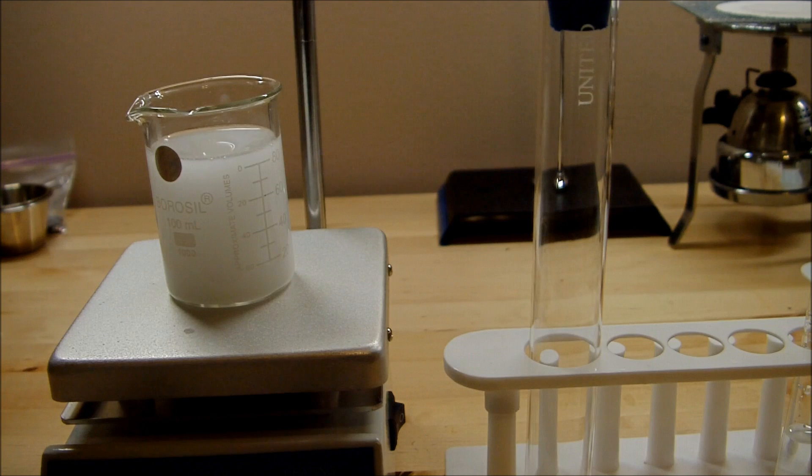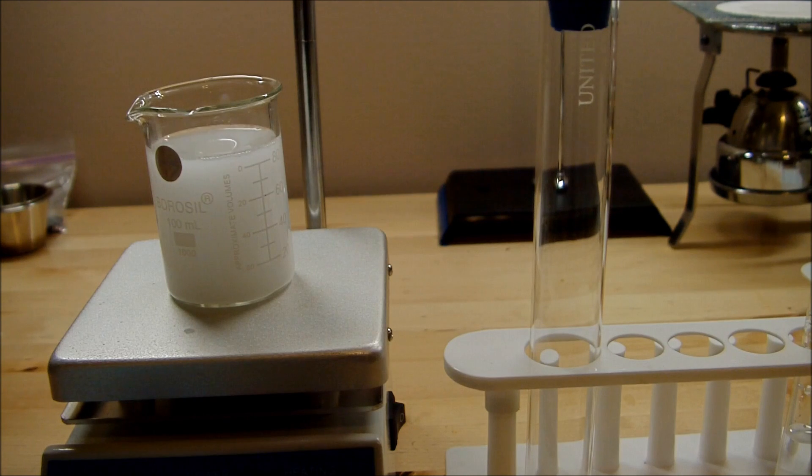When mixing these, you're likely going to need to heat the solution a bit just to get rid of all the precipitates. You want to have a clear solution so that when you pour it into your final container, you don't want to leave behind any precipitates. So I'll just heat this up until the cloudiness goes away.